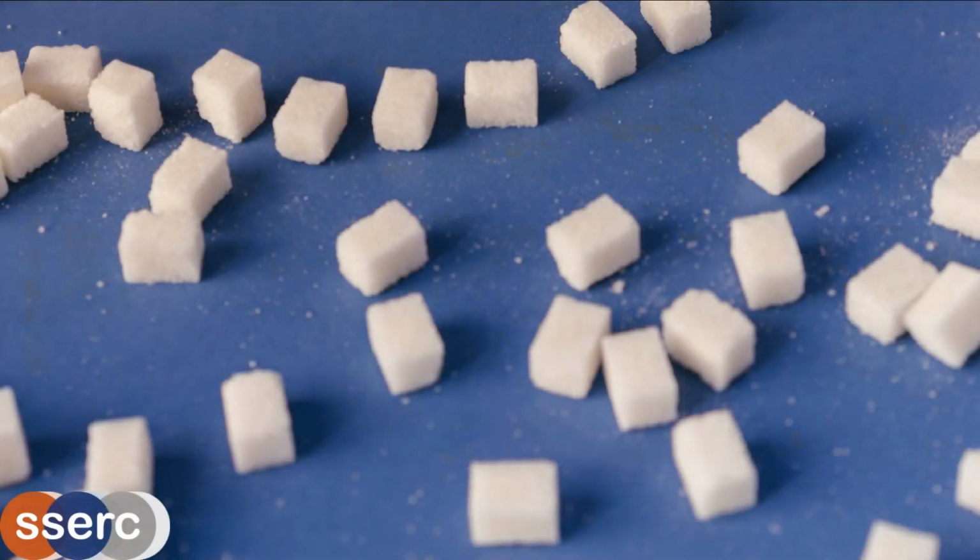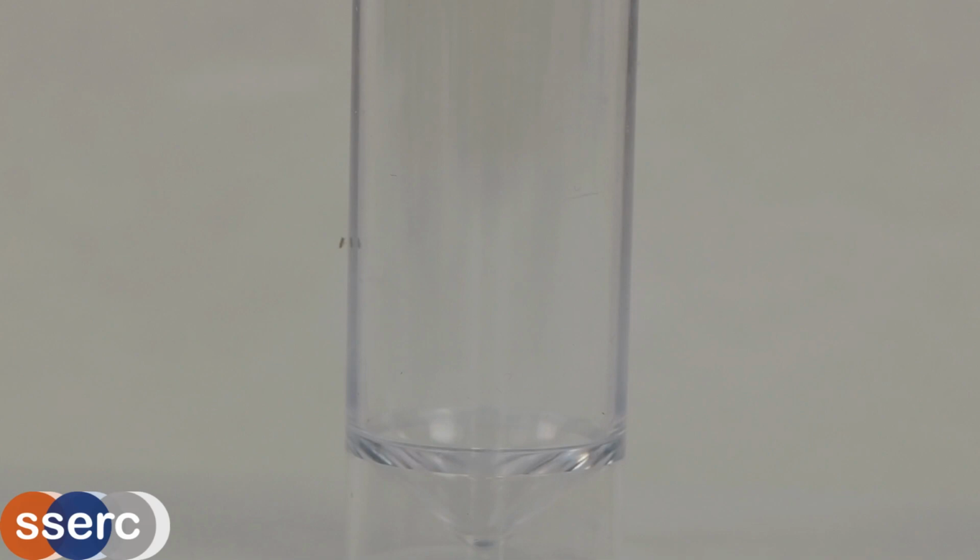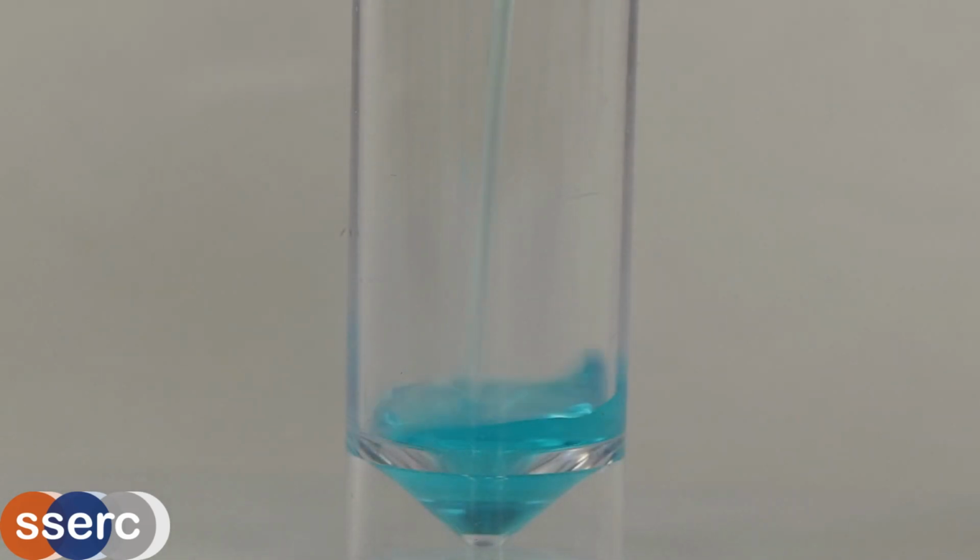There are several chemicals that can be used to detect the presence of sugars, and in this video we're going to look at a few of the more common ones. These all use related chemistry, the ability or not of sugars to reduce copper-2 in solution. We'll start with Fehling's solutions.